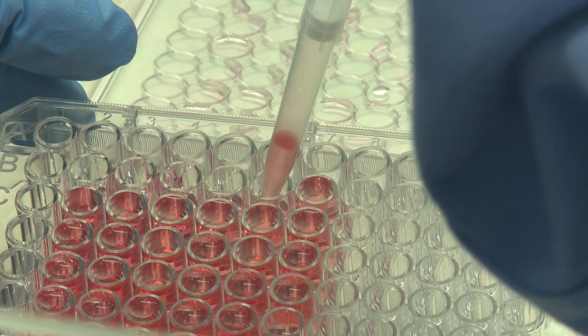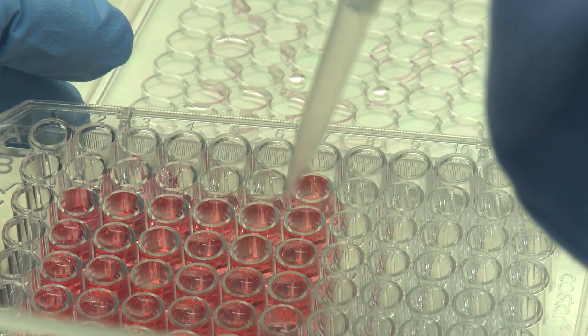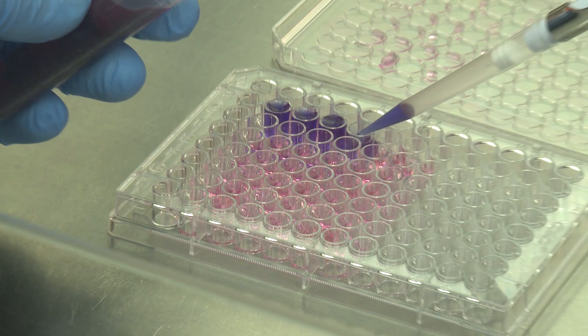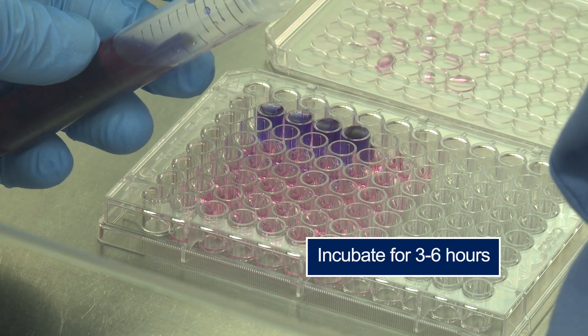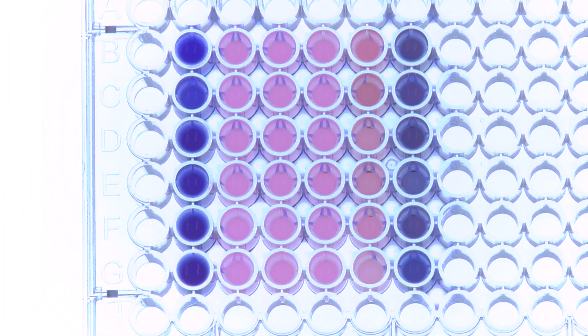Remove the treatment from each well and add a solution containing 10 percent Alamar Blue and 90 percent media. Leave the plate in an incubator for three to six hours. You should observe a color change from blue to pink.